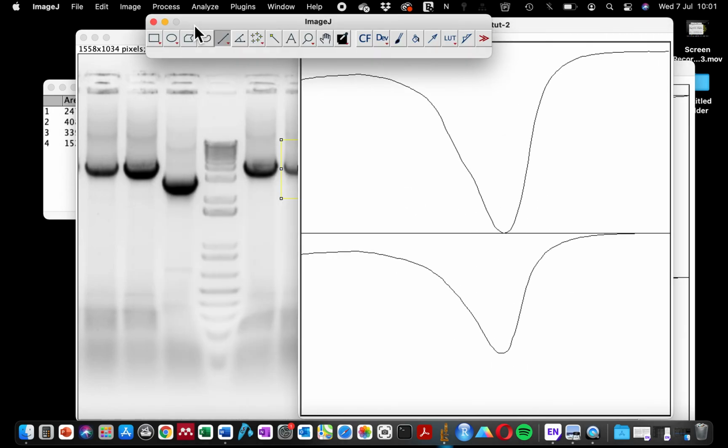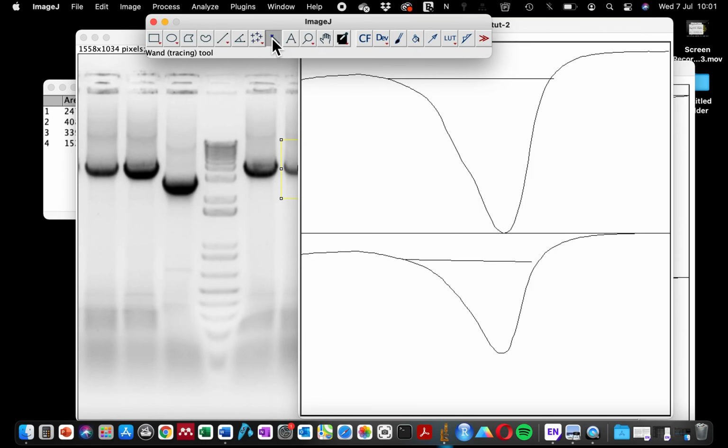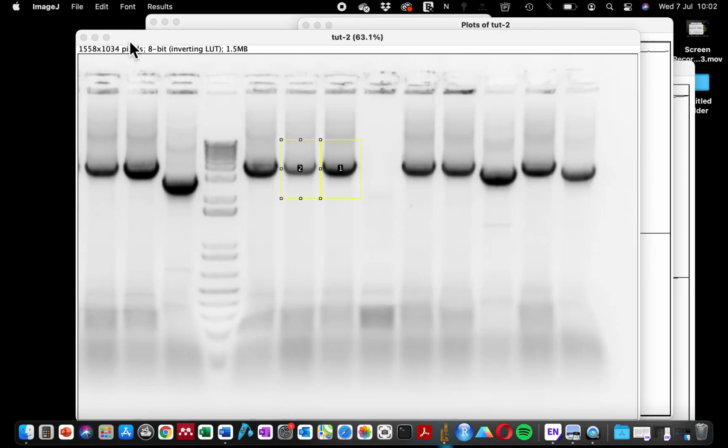So one common mistake that is easy to make is when you're doing your quantification, this line must touch. If it doesn't touch in the second one, imagine this is our weakest signal, but the line is not touching. When I do the quantification, you will be surprised at what will happen. So when I click on the rectangle, you see the yellow line is drawn only on the peak. If I click again on this one, it didn't select the peak. Rather, it selected the whole rectangle.